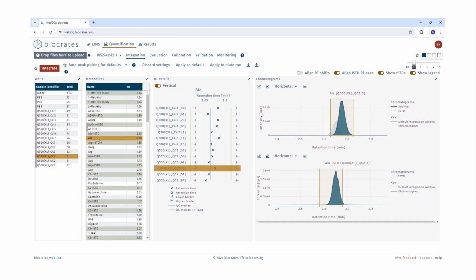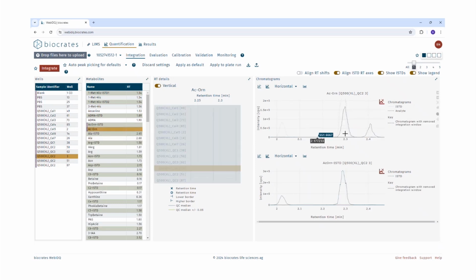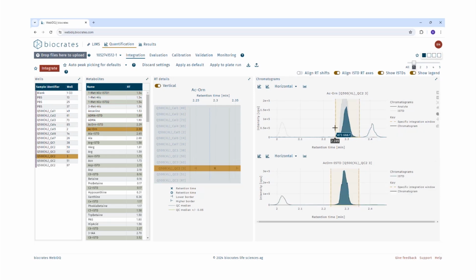It is possible to define or modify the integration windows by clicking once on either side of the peak. So now we can take this as an example where we see that the confidence indicator is active, and we can see that there are no integration windows defined for this particular metabolite. So to define the integration windows, just click once on either side of the peak. It is also possible to define the integration windows for the internal standard underneath the metabolite in the same window, just by clicking again on either side of the peak. These dashed lines here are the measurement specific retention time ranges.